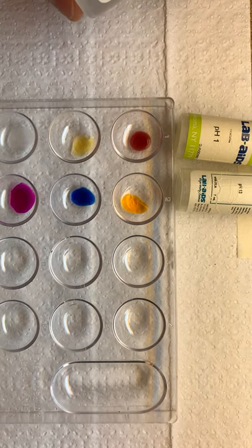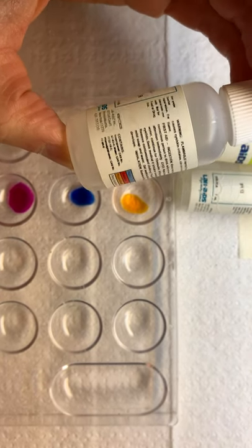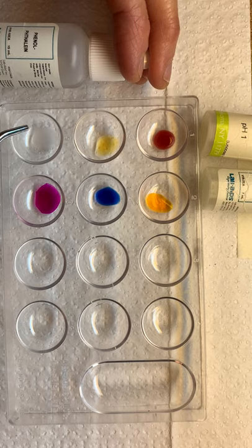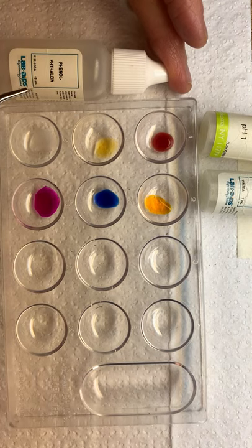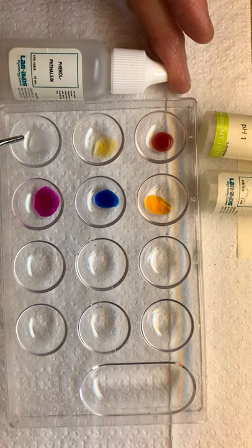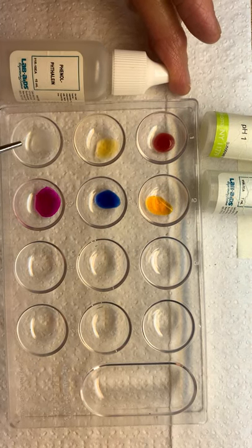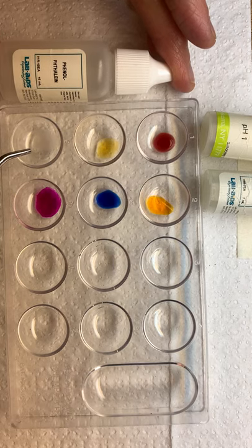Number seven: what color is phenolphthalein? Well, it's clear. So in this third row we've still got our pH 1 and our pH 13 with phenolphthalein. We know phenolphthalein is clear. It changes to what color in the presence of pH 1? Put a drop in — it's clear, isn't it? So in the presence of pH 1, which is an acid, phenolphthalein does not change.